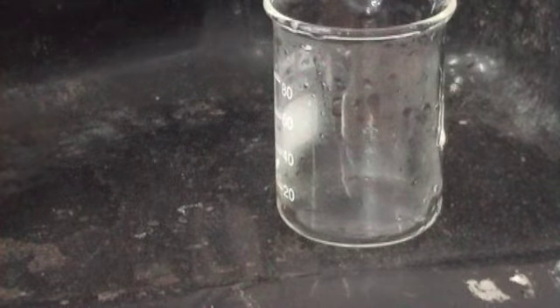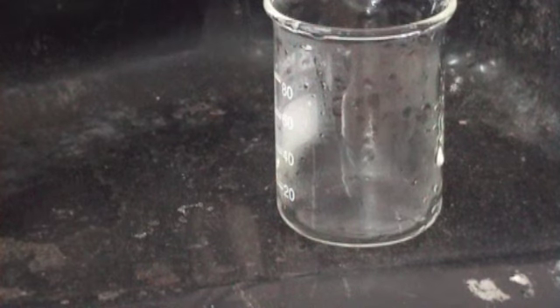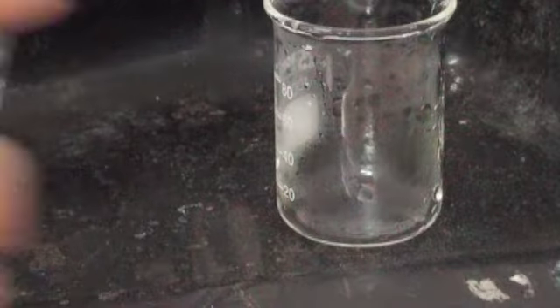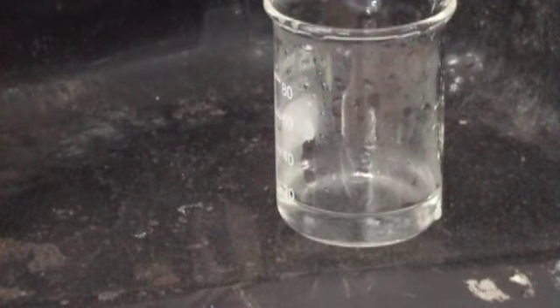And the third one is that of sodium iodide. Now, if you look at this bottle, it says potassium iodide. Will that make any difference? No. No, because potassium and sodium are interchangeable because they're always soluble, aren't they? Okay. So, identifying the cation. If I put some sodium hydroxide in, nothing happens, alright?